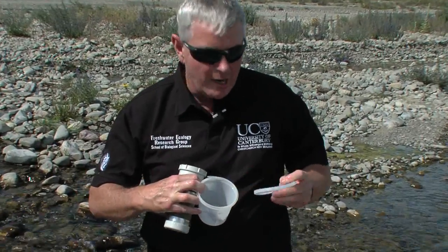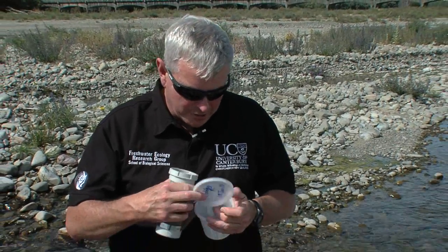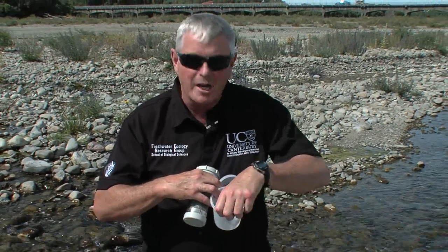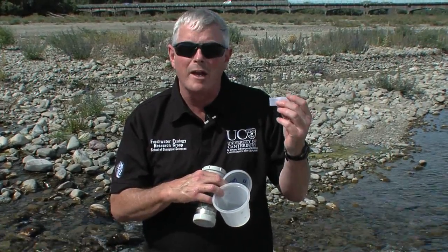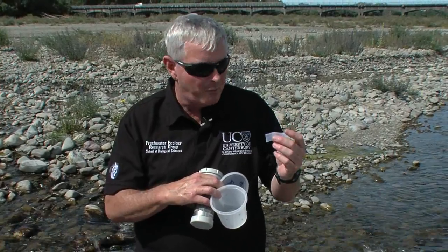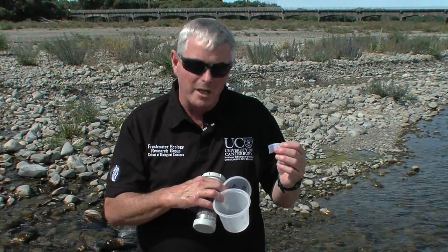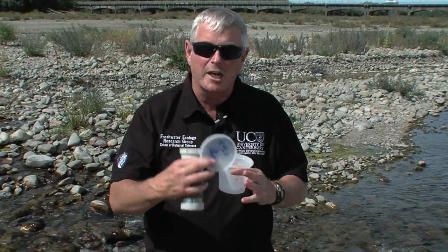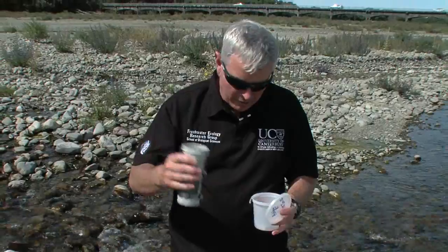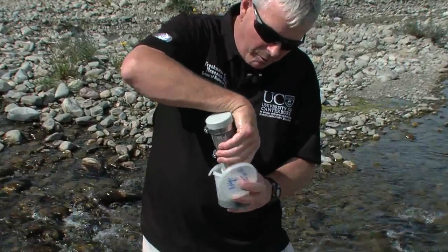This pottle here I've labelled — I've labelled the lid with the name of the site and the date. Often I might put who the collector was and may even have a site code. Something that's always worth doing is double labelling. I've pre-prepared a label here that I've printed out on waterproof paper. You could write on it in pencil and keep that inside the pottle, and then we've got a second label on the outside. We've now got our sample that we can transfer to the pottle.